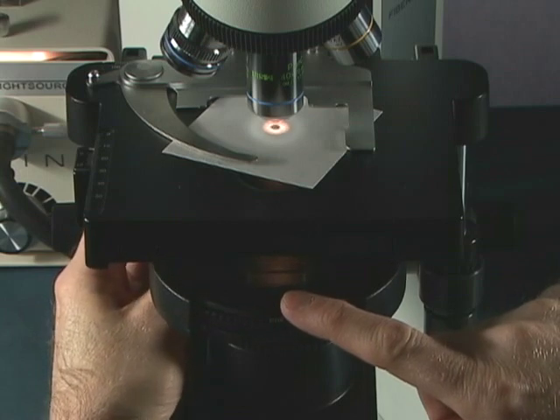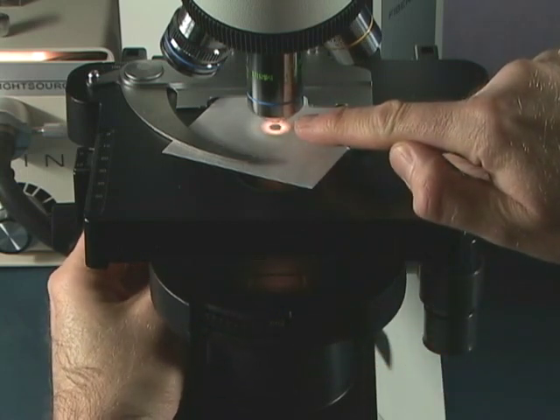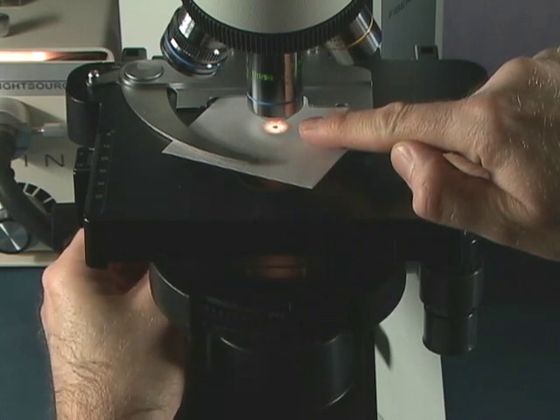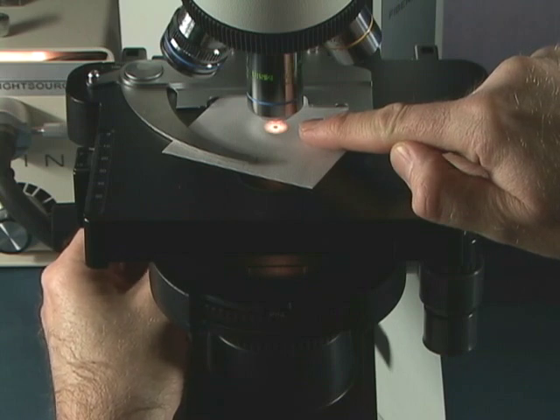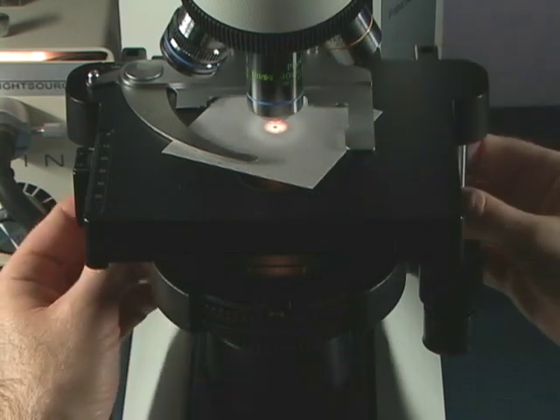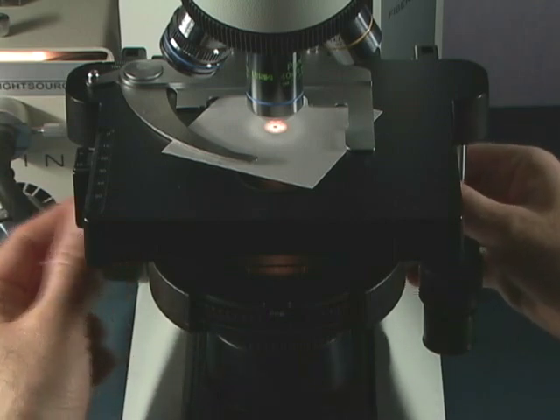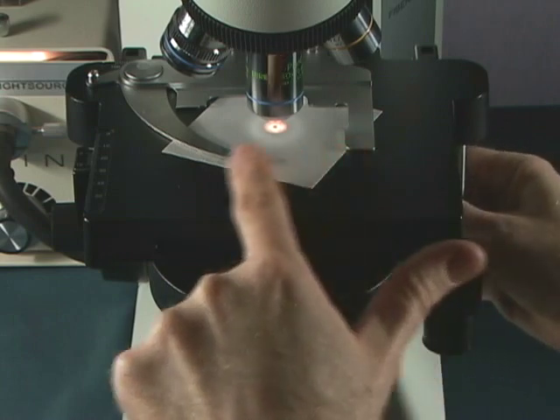And as you rotate the condenser down, you will see a little black dot forming right there. And we want it about the size of just a little tiny BB. Now once we have got that there, as we push our adjustment knobs on either side, that little dot actually moves one way or the other.